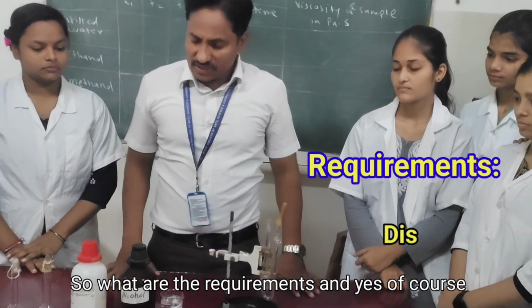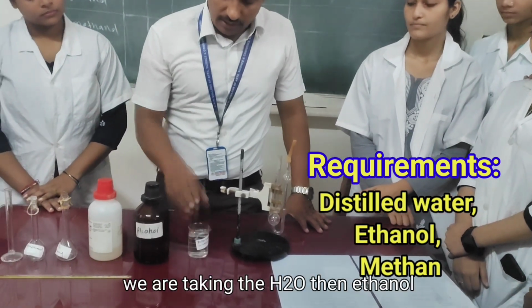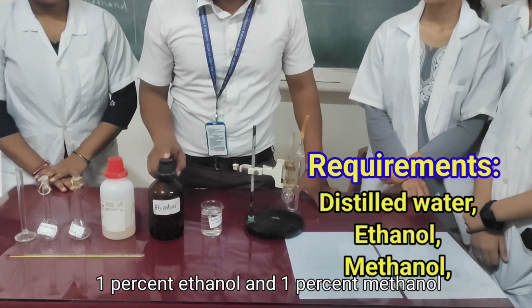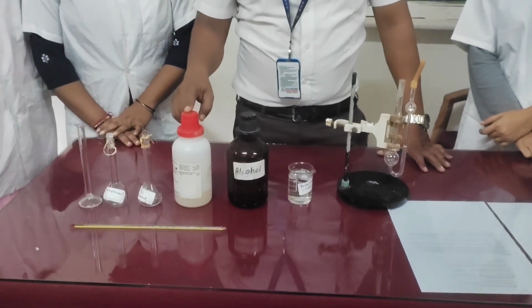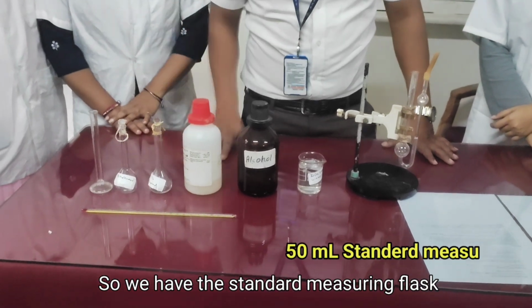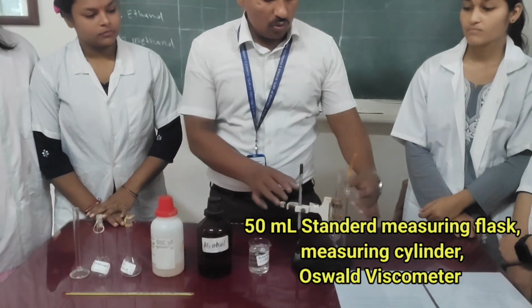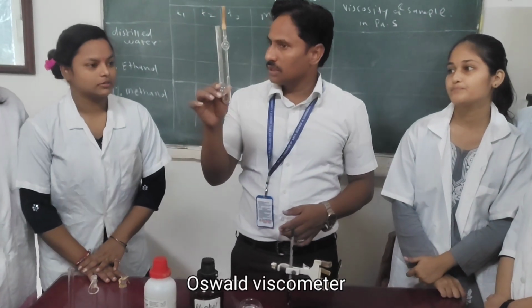So what are the requirements? Of course, we are taking distilled water. Then ethanol is there. We will prepare a solution of 1% ethanol and 1% methanol. We have taken about 50 ml, and this is a viscometer. What is this? Ostwald viscometer.